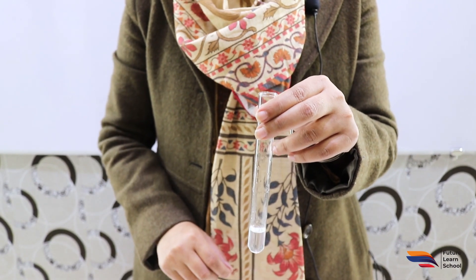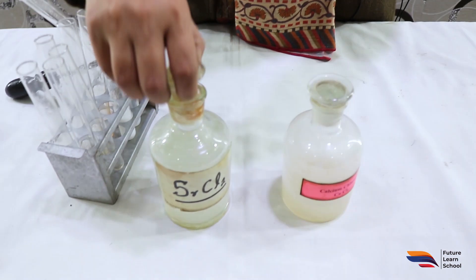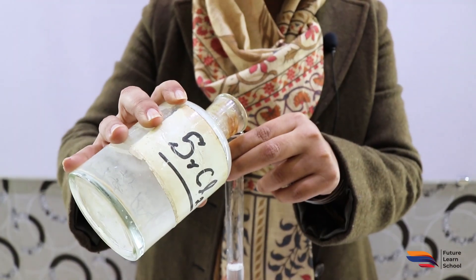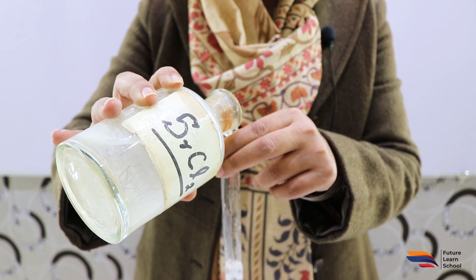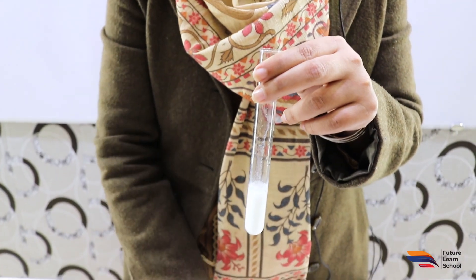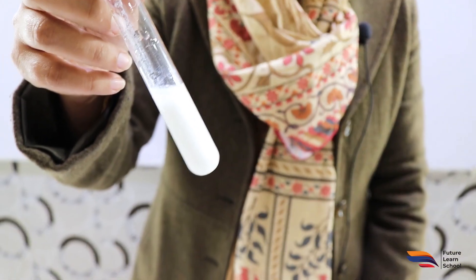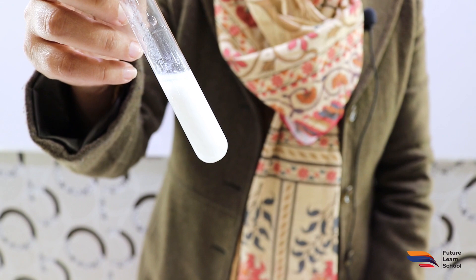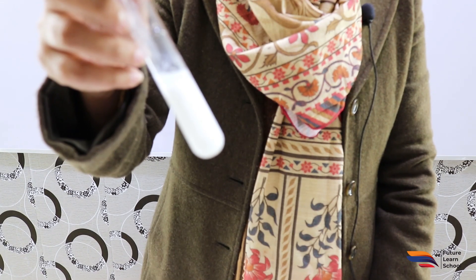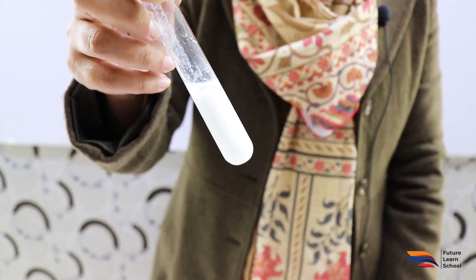The second confirmatory test is the strontium chloride test. We add a small amount of strontium chloride to the original solution. Here we can again see that white precipitates have formed, confirming the presence of the carbonate radical. Both of these confirmatory tests confirm the carbonate radical in our salt. Thank you so much.